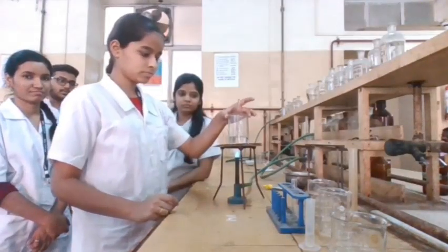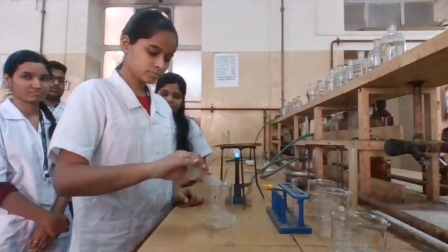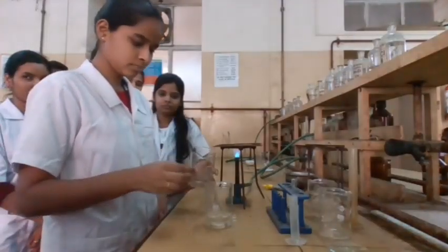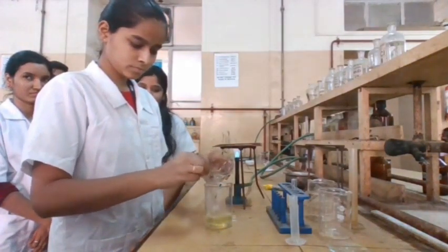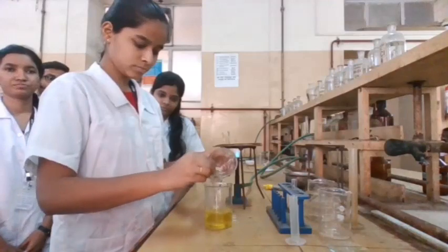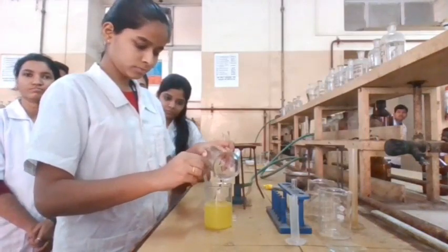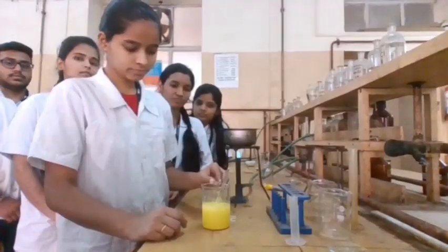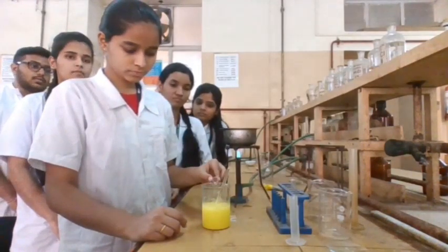Heat the solution to 40 degrees centigrade till fumes come out. Remove the beaker and add 3 ml concentrated HNO3, then add 3% ammonium molybdate solution with constant stirring until phosphate is completely precipitated as ammonium molybdophosphate. To ensure complete precipitation, add 5 ml excess 3% ammonium molybdate solution.